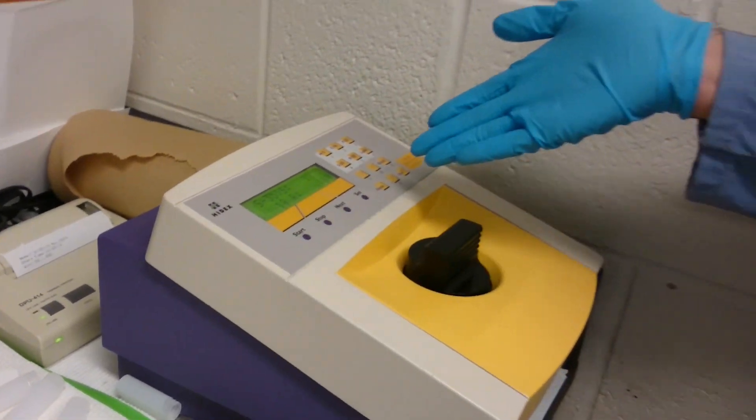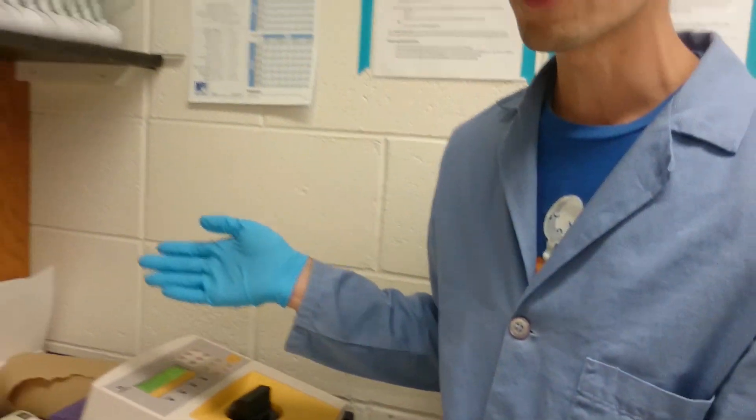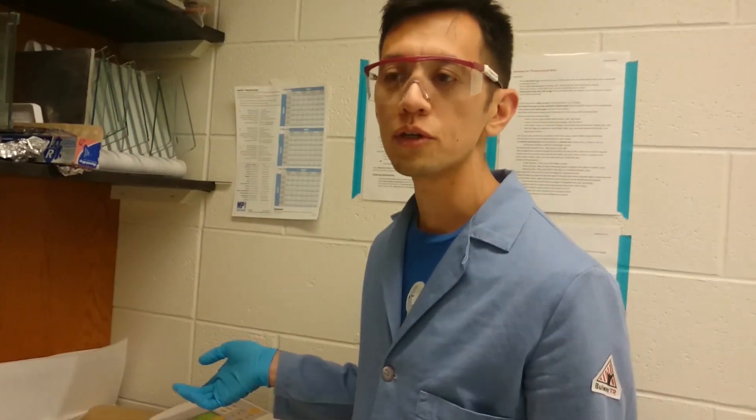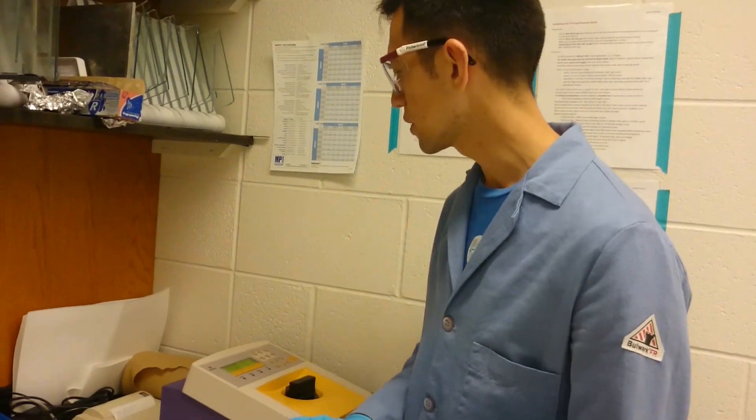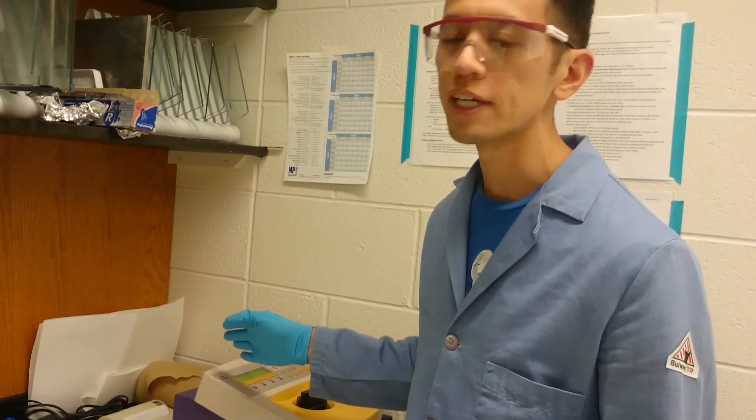This is reasonable enough. You can continue to do other things while you are waiting for that to finish counting. Just make sure you check it before you move on to the next part.